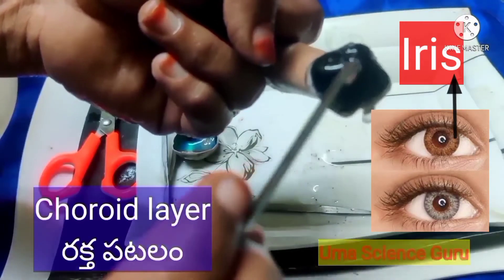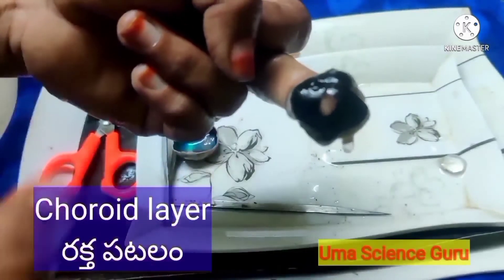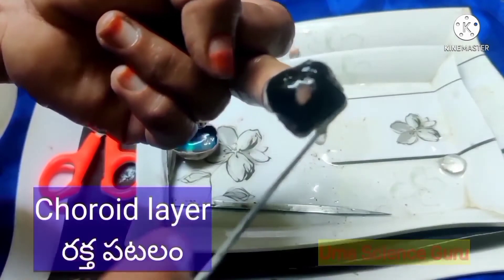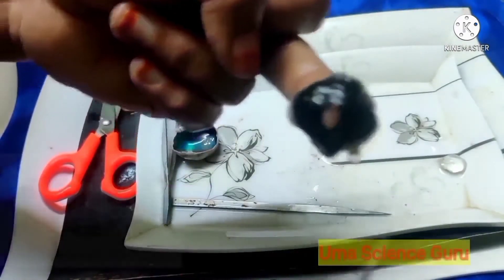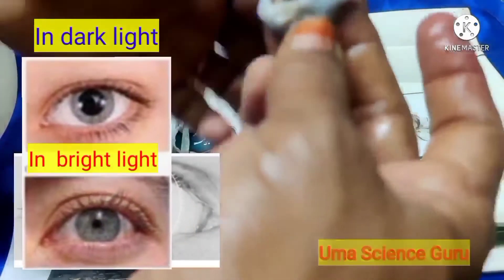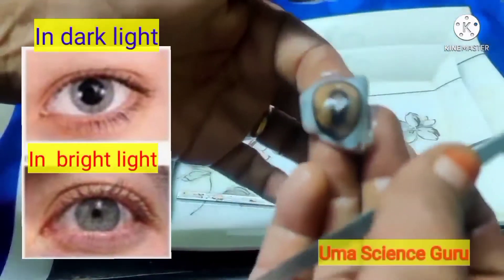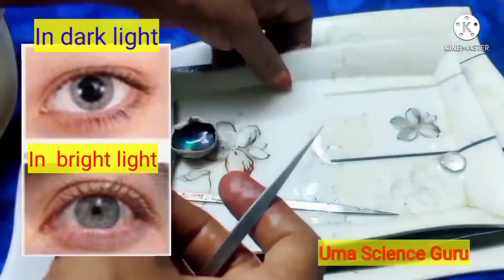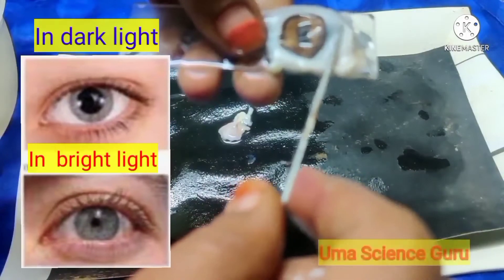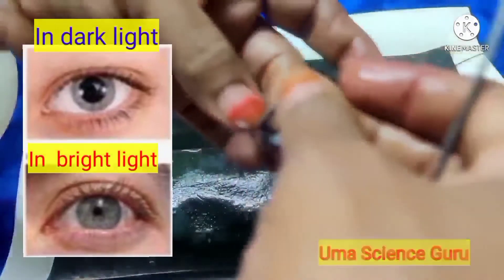Students, clearly observe the hole called the pupil, present in the center of the iris. This pupil allows light to enter the inner chamber of the eye. The iris is a muscular structure containing radial and circular muscles to adjust the size of the pupil. In darkness, the pupil expands and the aperture becomes larger, allowing the maximum amount of light to pass through.